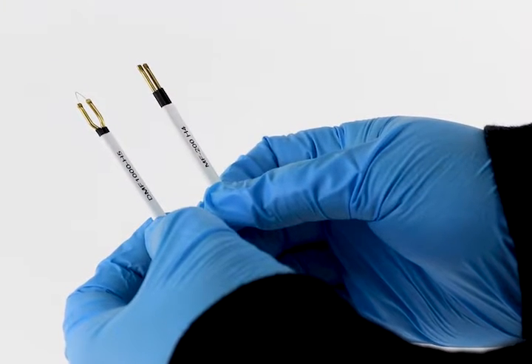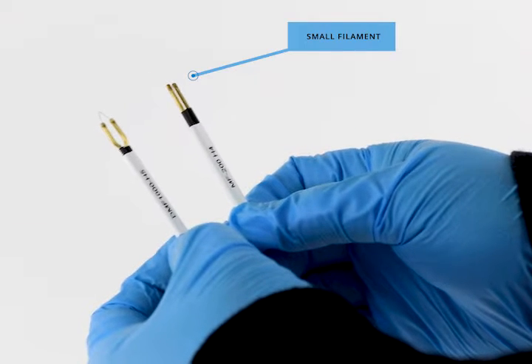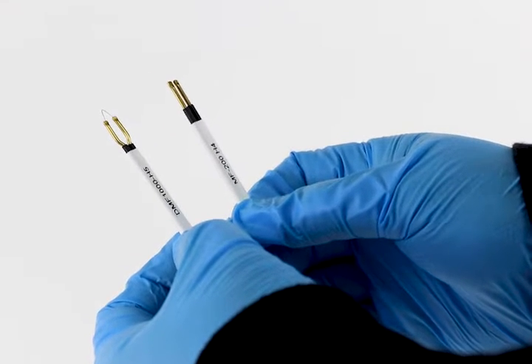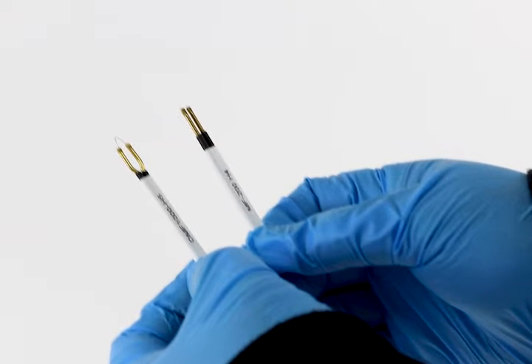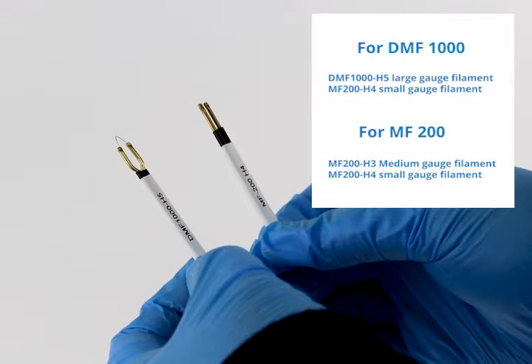After you turn on the power to the microscope, you must choose the desired filament. The small filament is better suited for microforging pipettes that are 1 micron or less. The larger filament should be used for larger pipette forging, forming, and sizing.